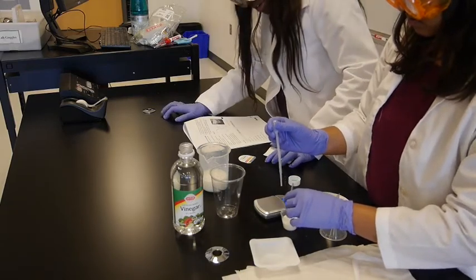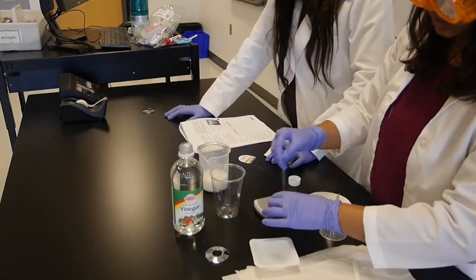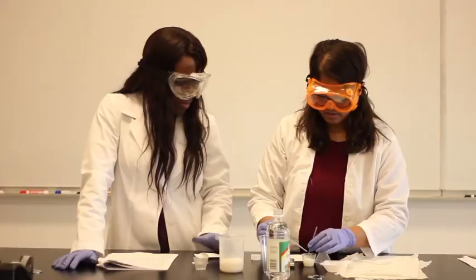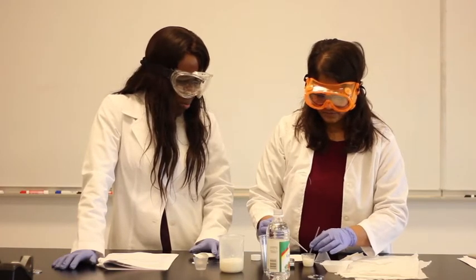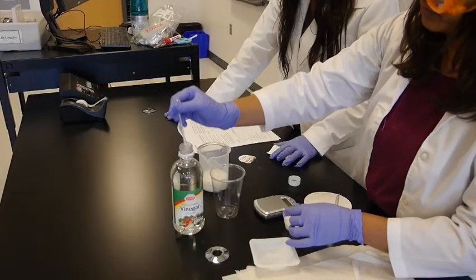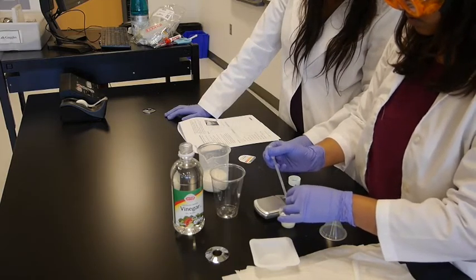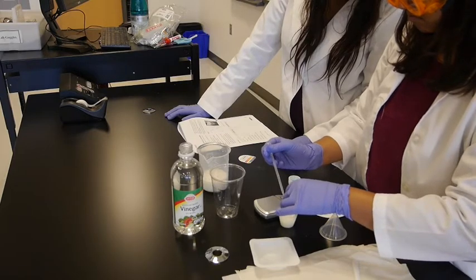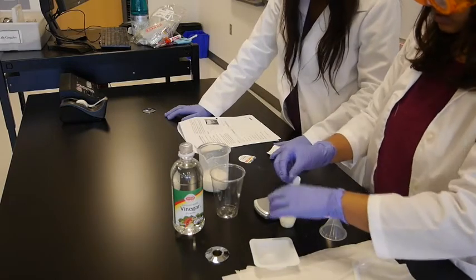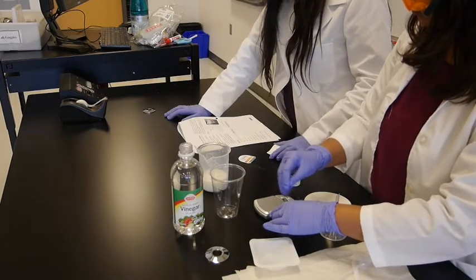So you add drops and you observe. It should be thickening and separating. You see, already it's coagulating. So let's keep adding. See, this is the casein settling down at the bottom of the suspension. Do we need more? Almost done, it looks like. Next, what we are going to do is test the pH.